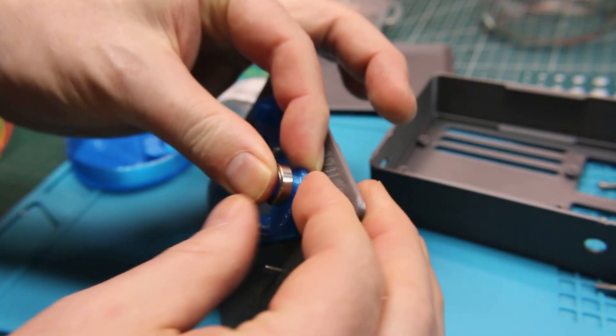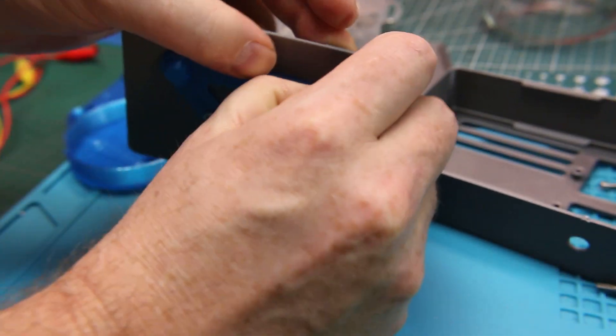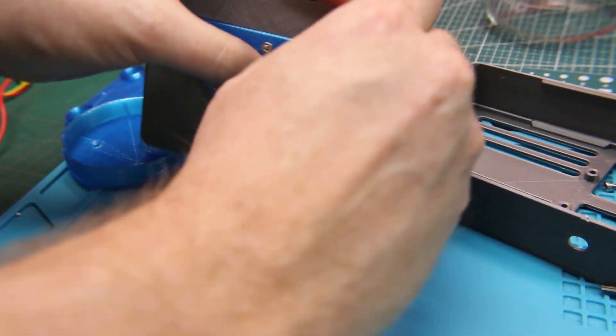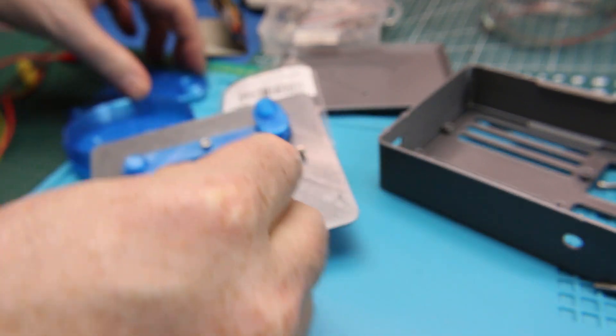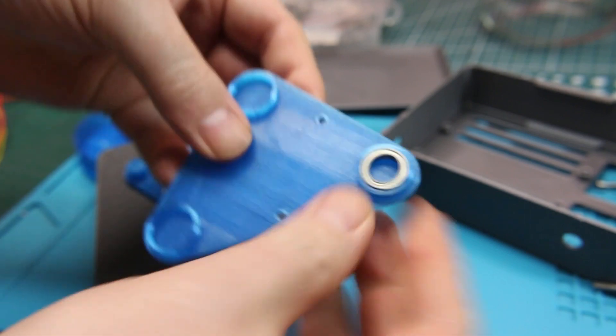The bearings were a little bit more of a fight. I ended up having to remove just a tiny bit of material from the 3D printed parts. Just a tiny bit of over extrusion on the posts. No big deal.